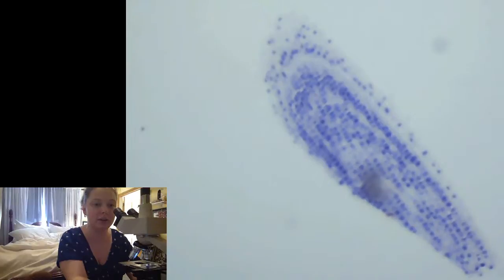Okay, so part of this was I wanted to show kind of how microscopes work. When you're using a microscope, you always start with the stage all the way down and nothing is focused, and you start on the lowest possible magnification, and then you bring it up into as focused as you can get. This is a little bit hard because what you guys see in the camera is not as good as what I see.